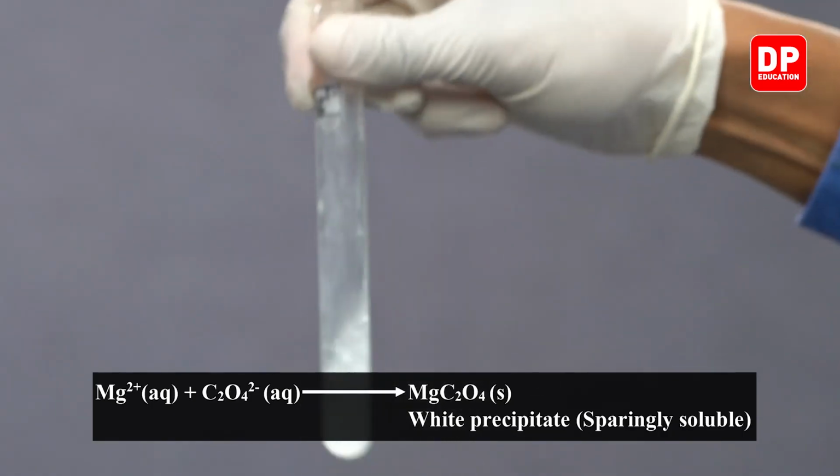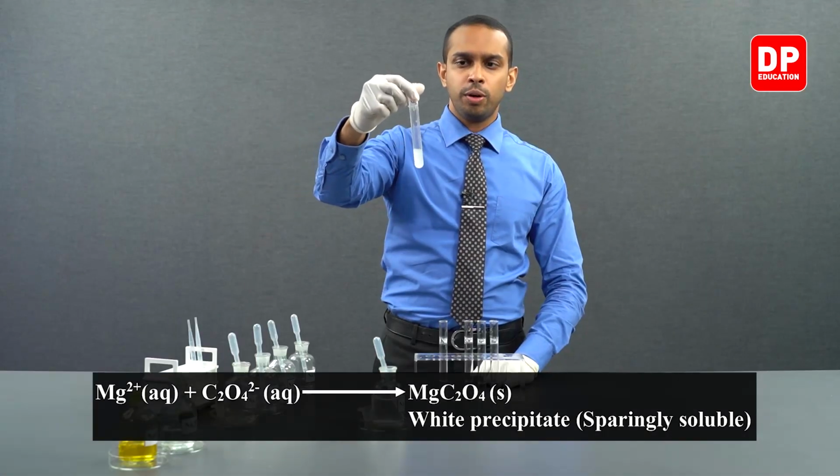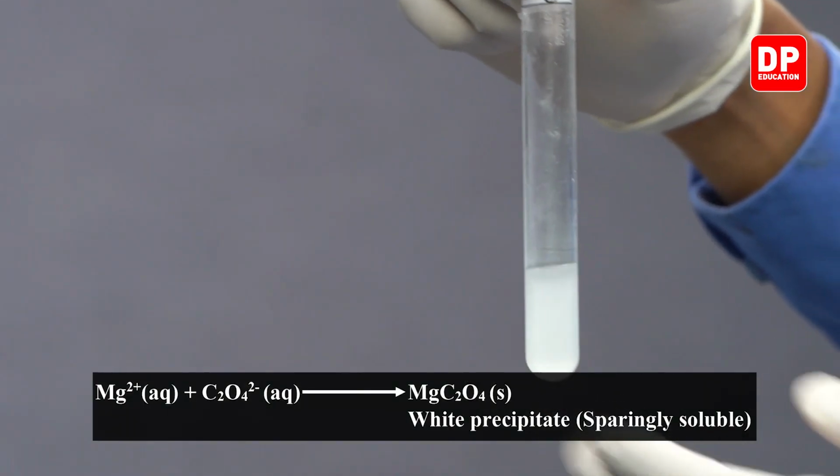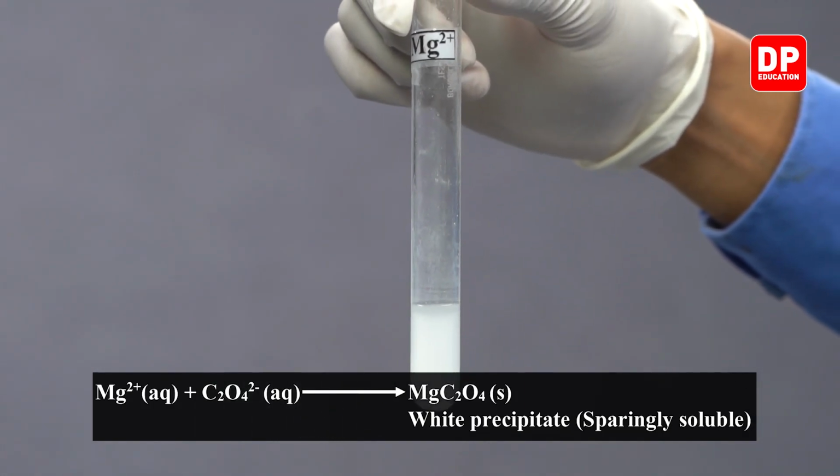After shaking it for a while, we can see the formation of magnesium oxalate.